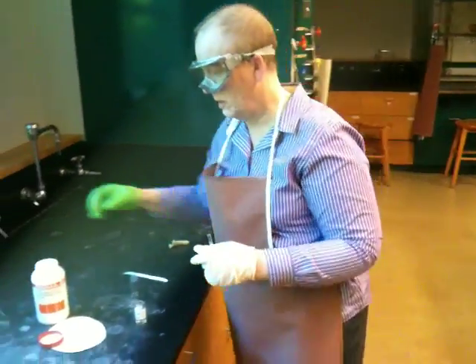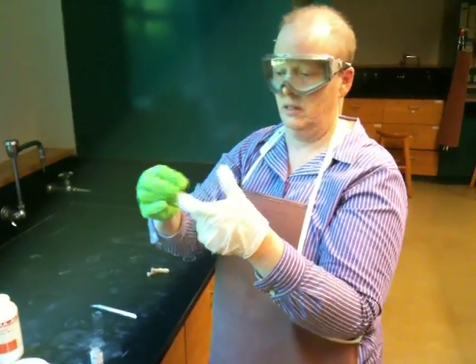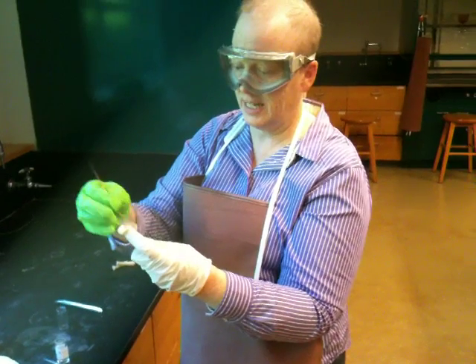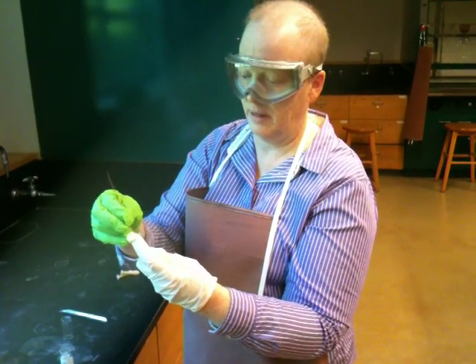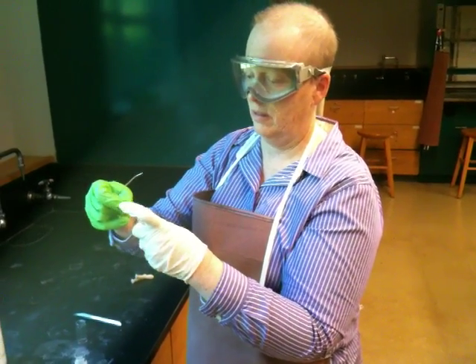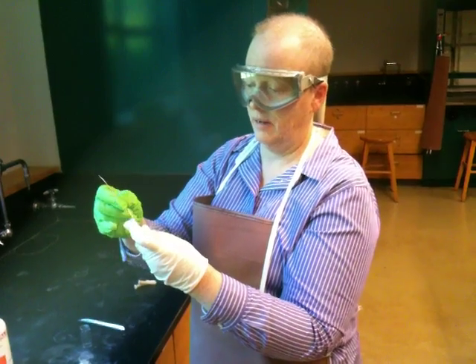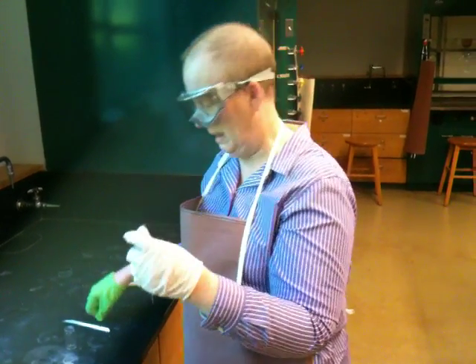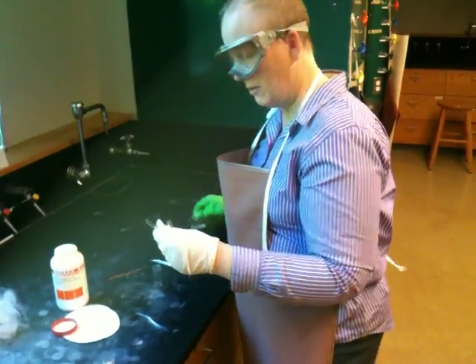Then what we do is we take another little piece of glass wool. You don't have to do this. And we plug it in the top. This is just in case, supposing your sample has a little bit of particulate matter. If your sample has a little bit of solid in it, it will get filtered out. You probably don't need that piece. That's not totally necessary. Now what I'm going to do is take another pipette.